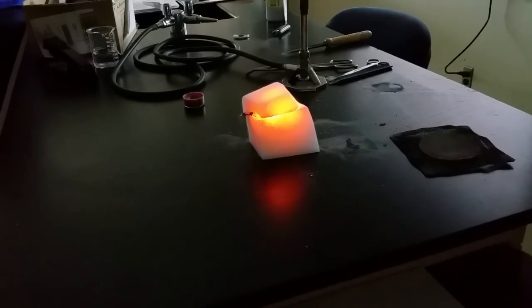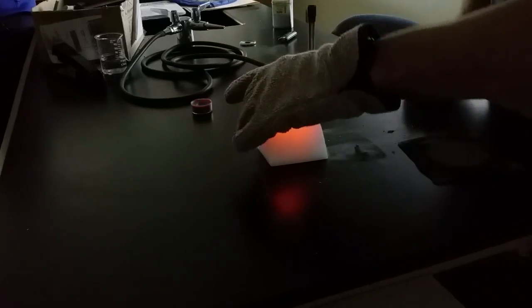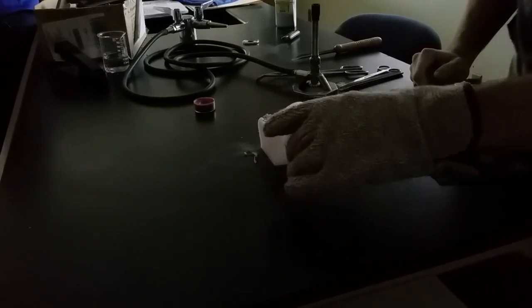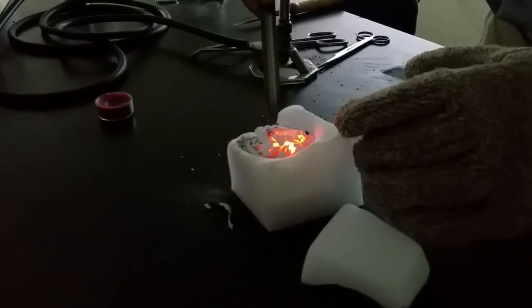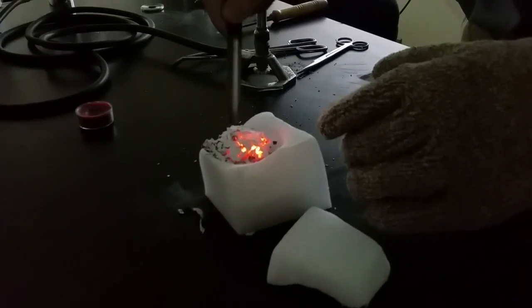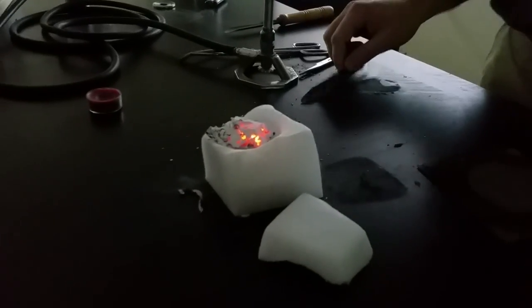It just smells like fire. Yeah. So it's still burning. Can somebody get the lights for me? Thank you. Alright.